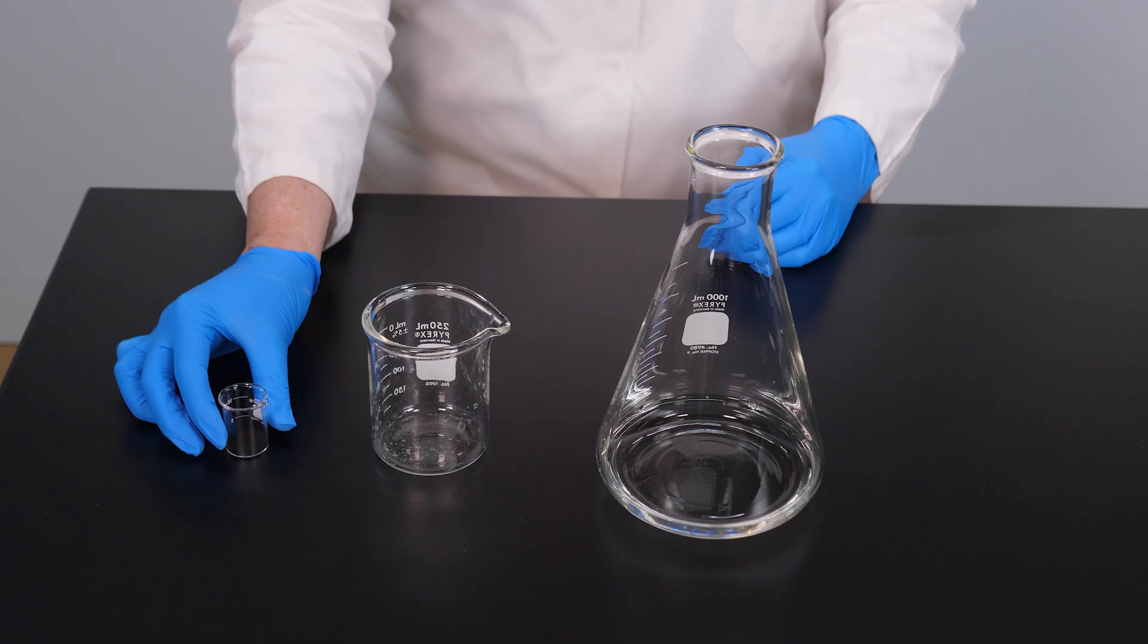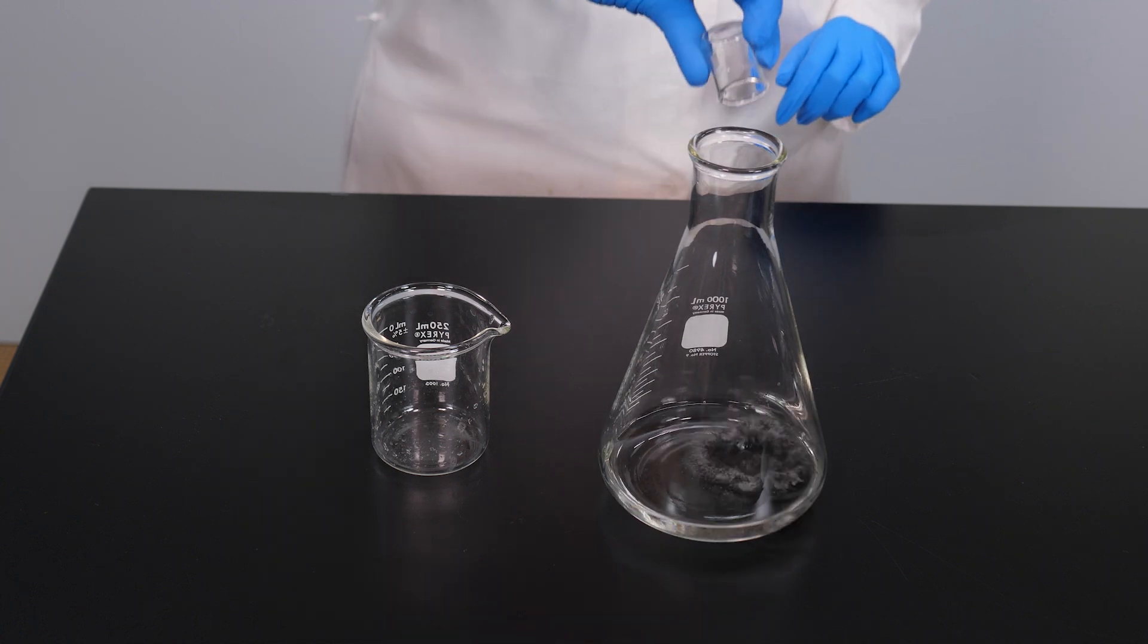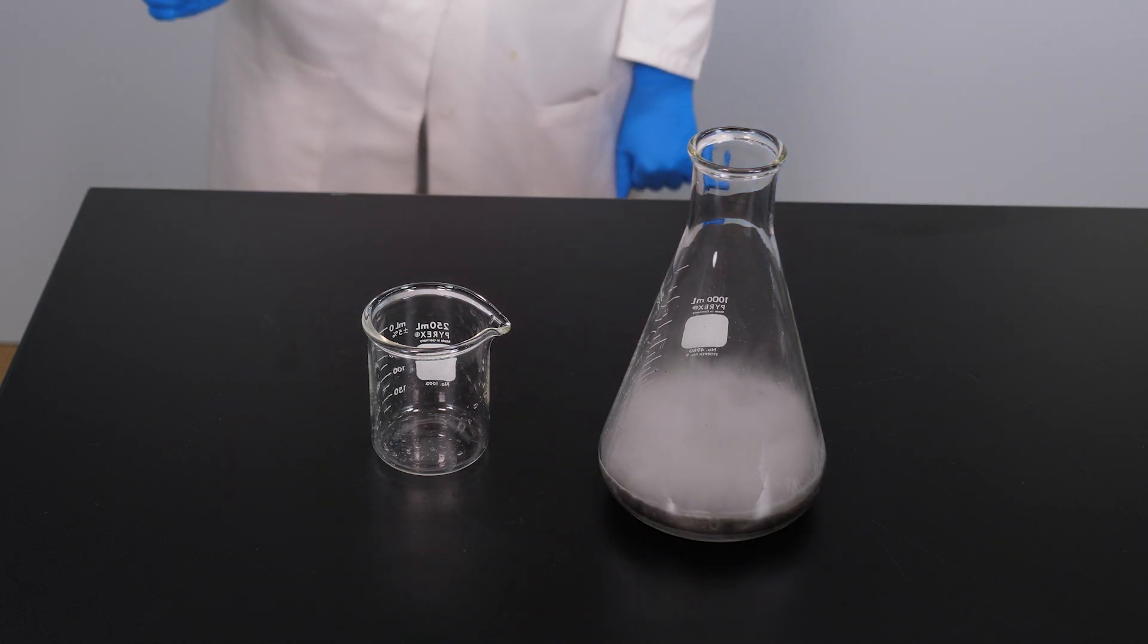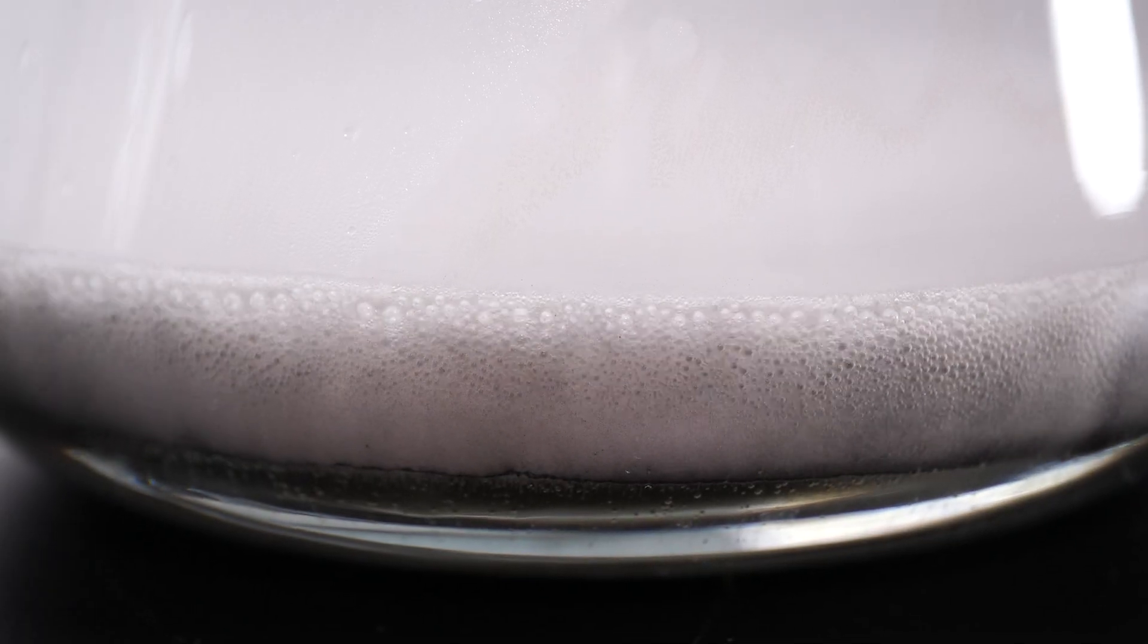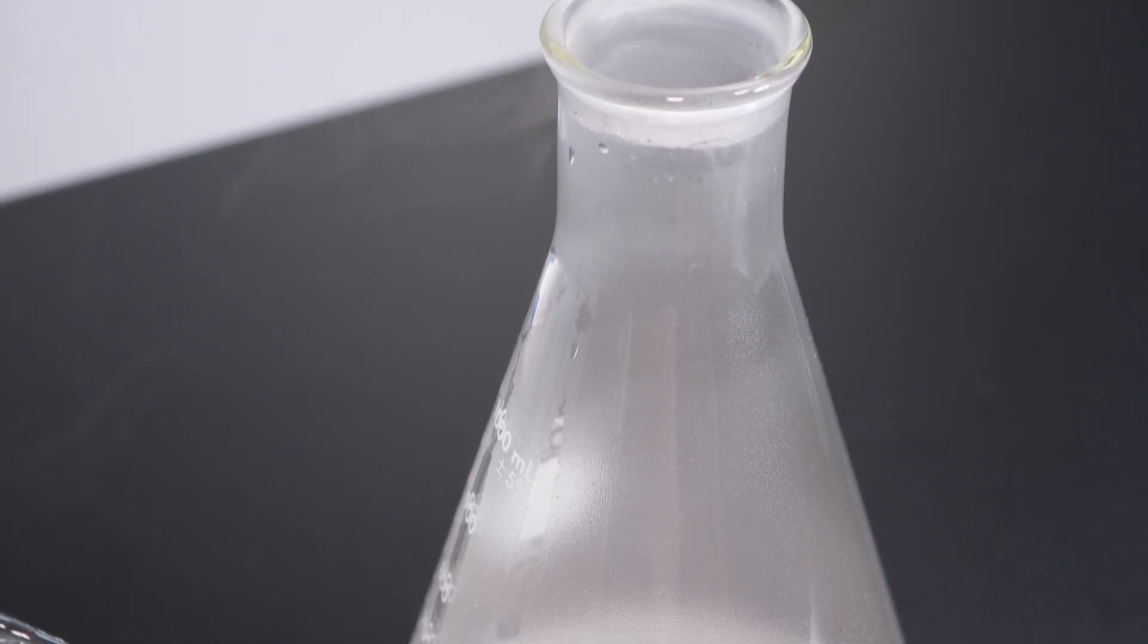Now, let's see what happens if we try this same reaction with manganese(IV) oxide as a catalyst. The hydrogen peroxide we are using is a much stronger concentration than the peroxide you find at your local pharmacy or grocery store. The reaction is extremely rapid, and it is so exothermic that the water boils, and a cloud of water vapor and oxygen is produced.